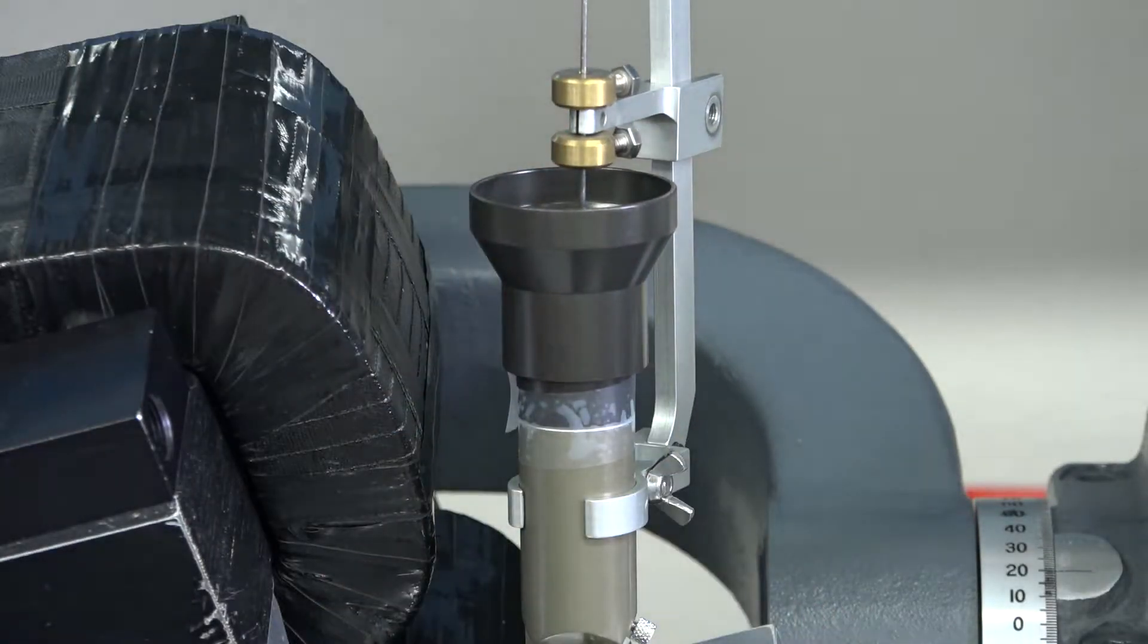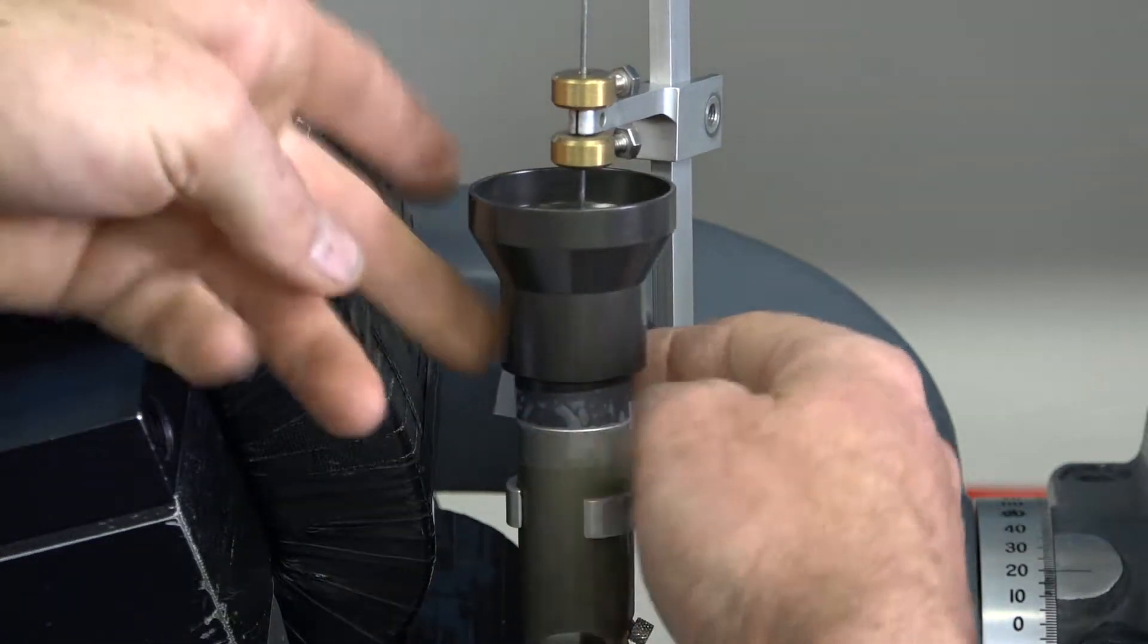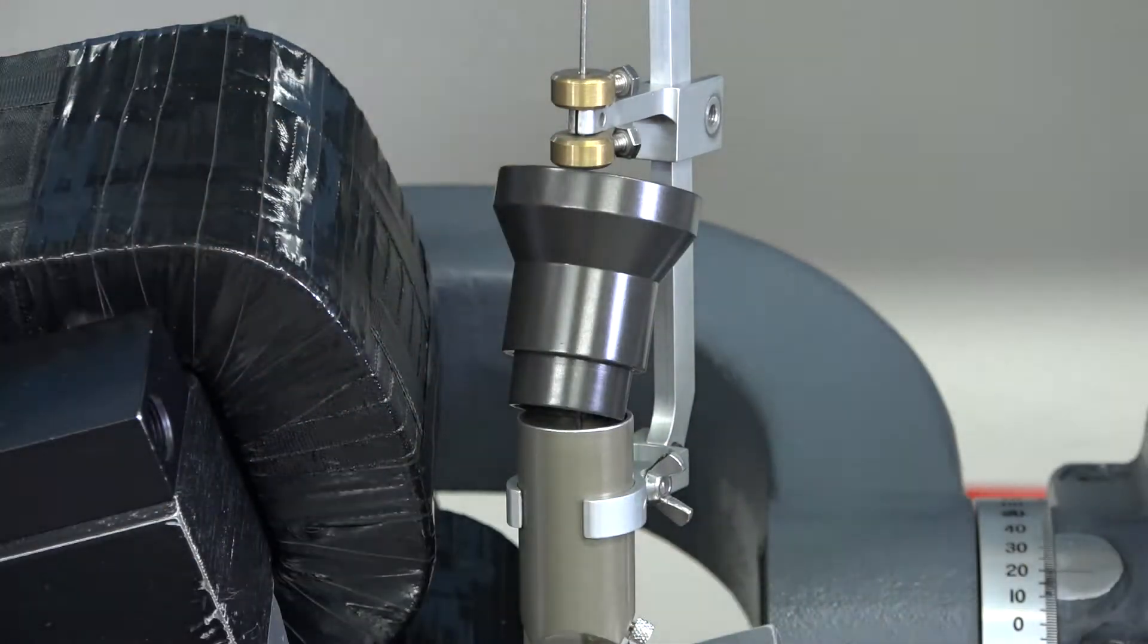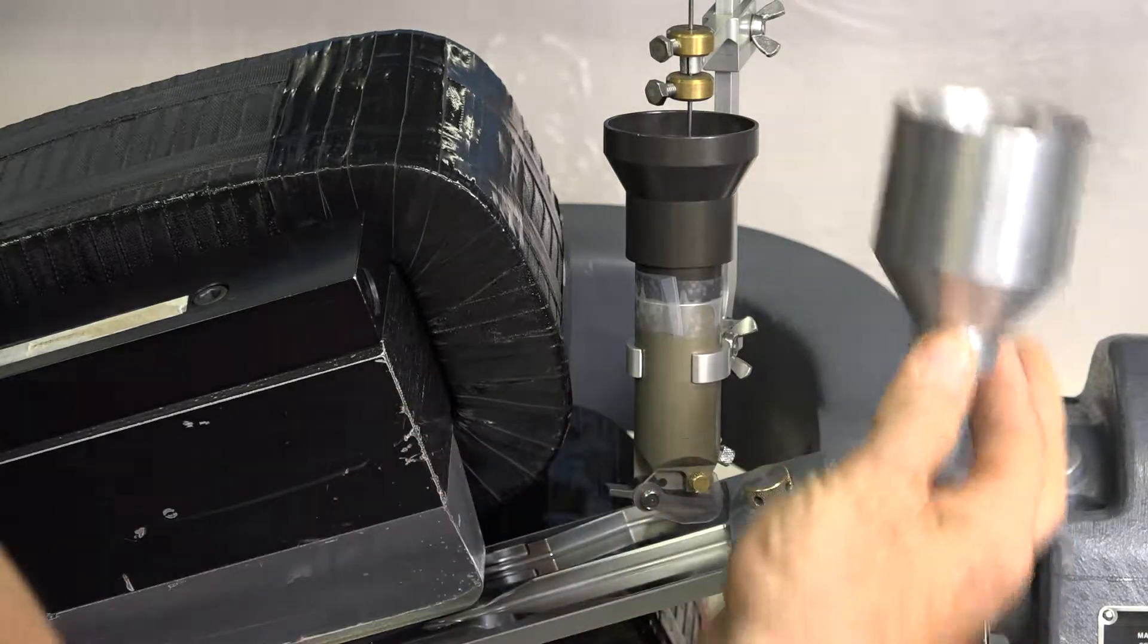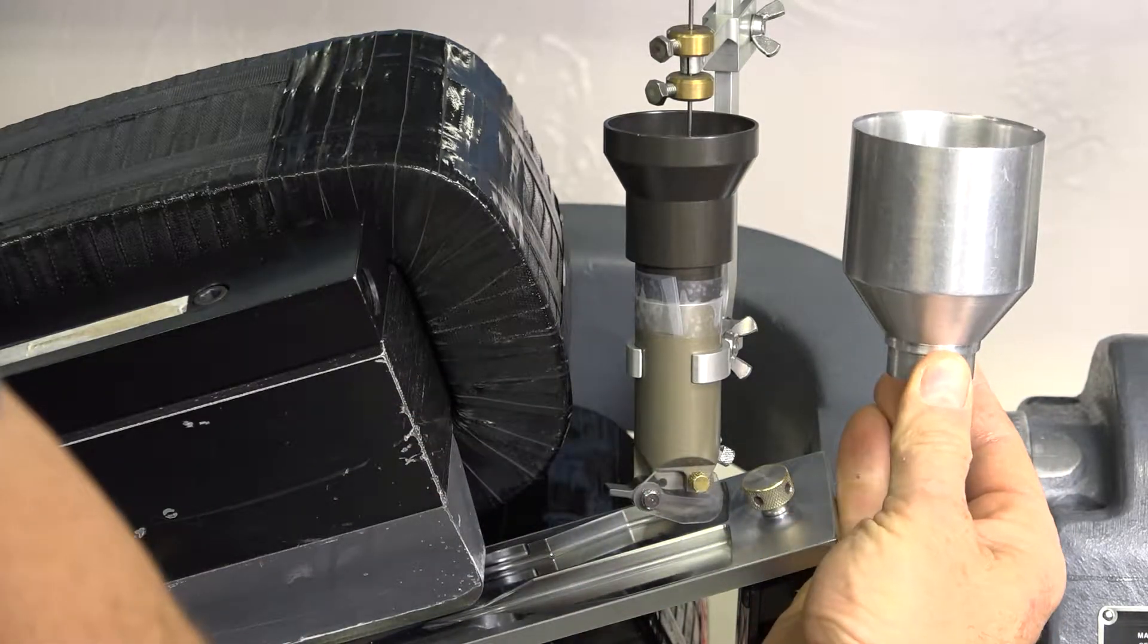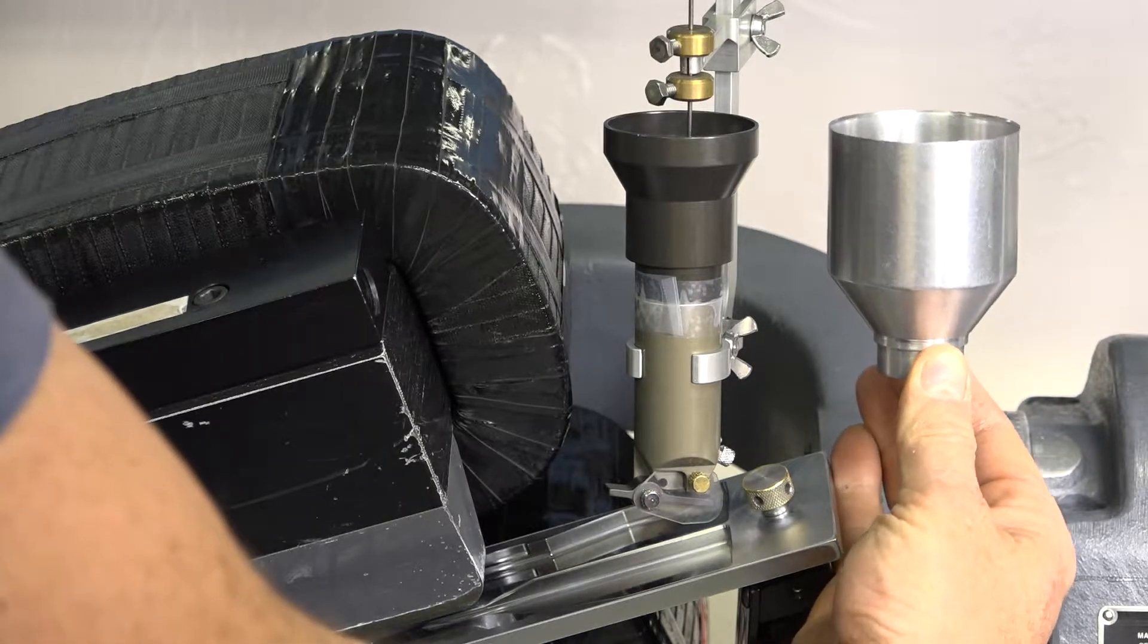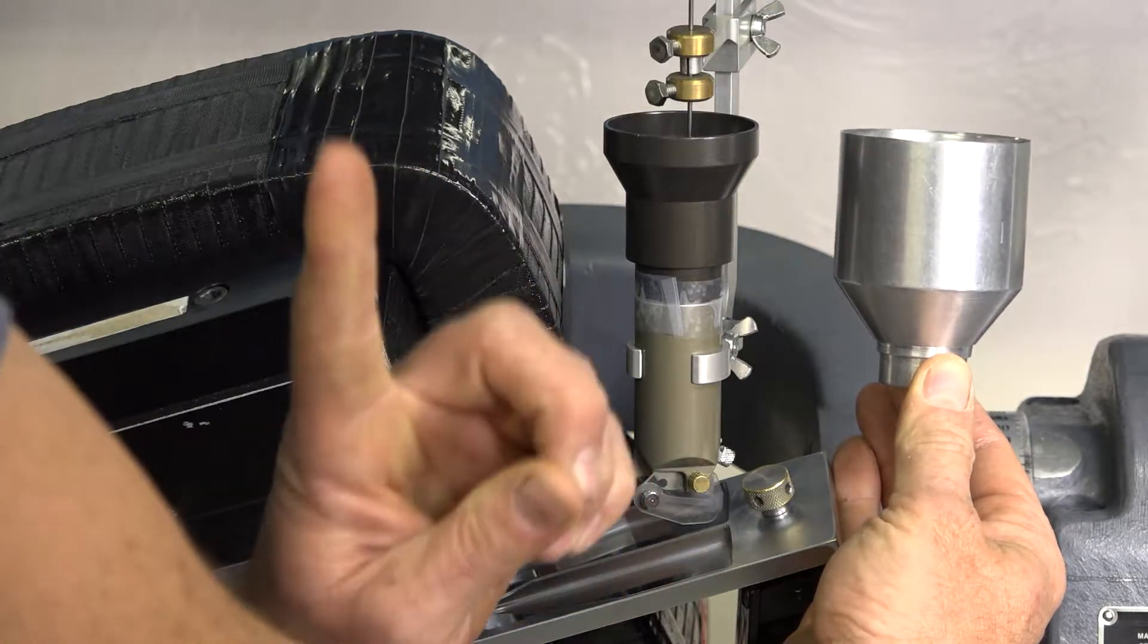Your Frantz probably came with a tube, but we found it's such a fight to get that tube on and off. Just a piece of tape is real easy. And then when you want to unpeel it, you just find that flap, peel it slowly, and that way you're not in a big fight. Since we have so much throughput in our lab, I made a gigantic sample holder. If you would like to order one of these for your Frantz, if you're running larger samples, click the screen right up here.